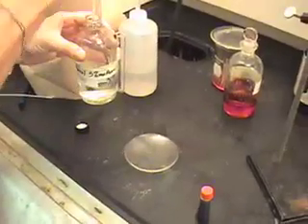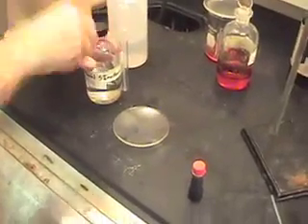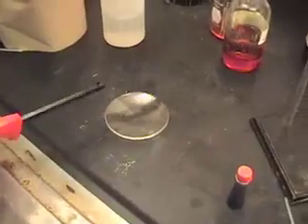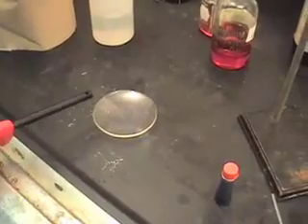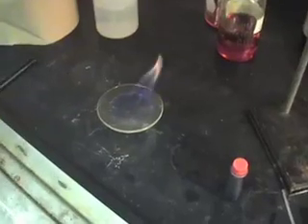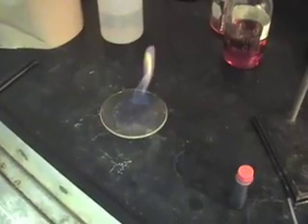One of the things that is different about this clear colorless liquid compared to water is a chemical property called its ability to combust — its combustibility, its flammability. You can notice that it is burning now. Water certainly doesn't do that, so that is a chemical property.